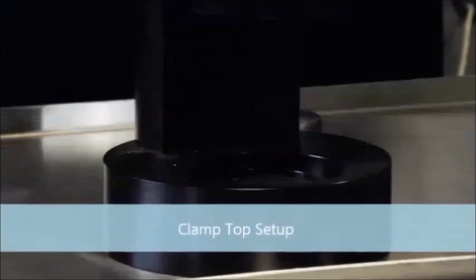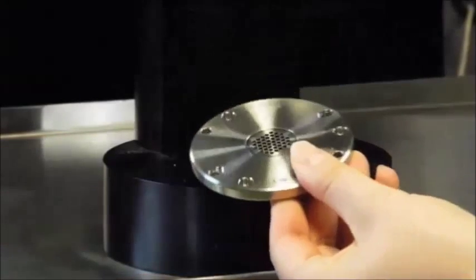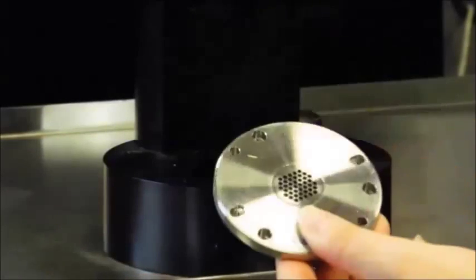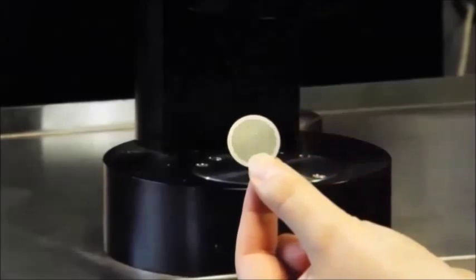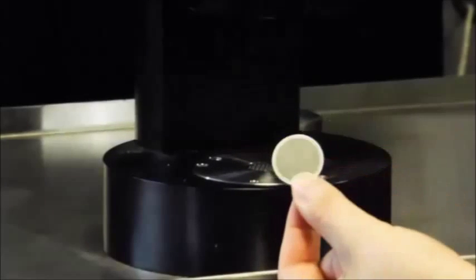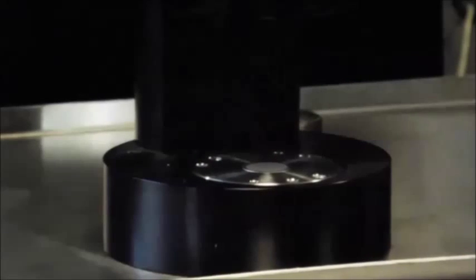another way to run samples, usually large flat sheets that you don't want to have to cut up and put in the sample chamber. This adapter plate has a bunch of small holes in it to support samples that are too fragile to have one large hole underneath them. This is another millipore screen for a little added support. It has much smaller holes, which means smaller gaps for the sample to get pushed into, so the sample will remain intact even if it's very soft and fragile.